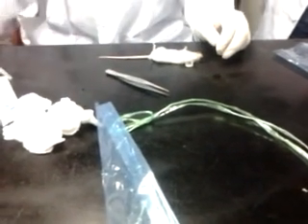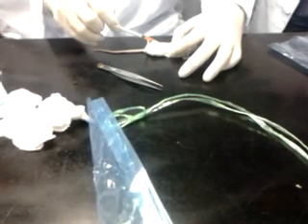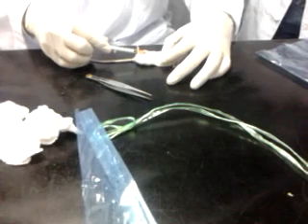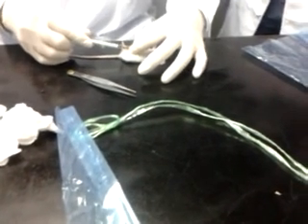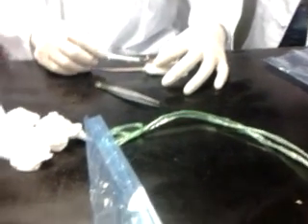We also can use that to give IV later on if you want. If you want to do cardiac puncture, with a 1 ml syringe, go under the sternum, hold, and insert the needle into the chest cavity, then pull your plunger for negative pressure. Once you reach the heart, then you can pull. You hold this so it's stable. This is cardiac puncture.